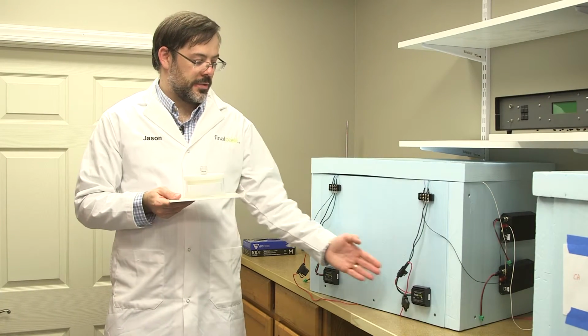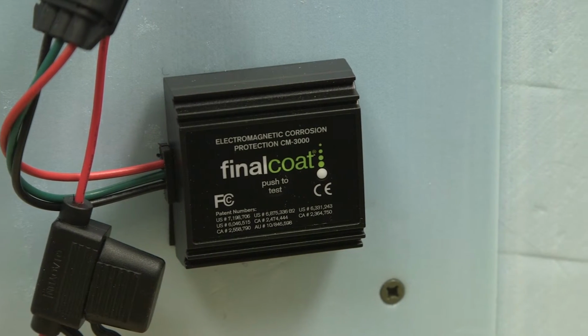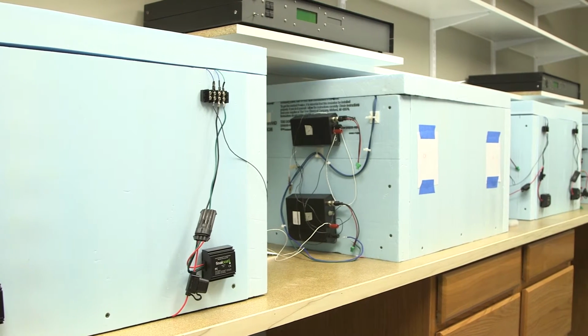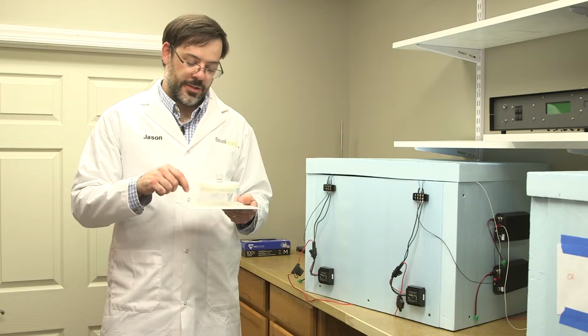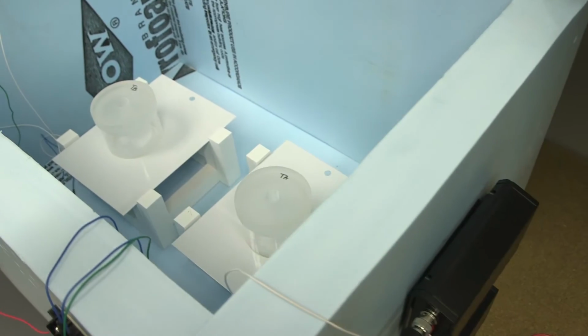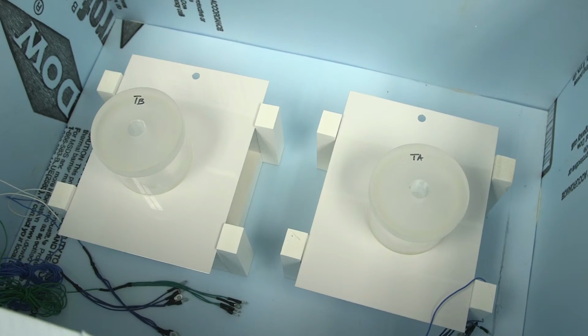One chamber is shown here, is called the test because it has the module on it. The other chamber does not have modules connected. The modules are connected directly to the panel. A different panel than is shown here, that panel has electrical connections for the module. And the point of this experiment is to measure the corrosion potential with and without the module.